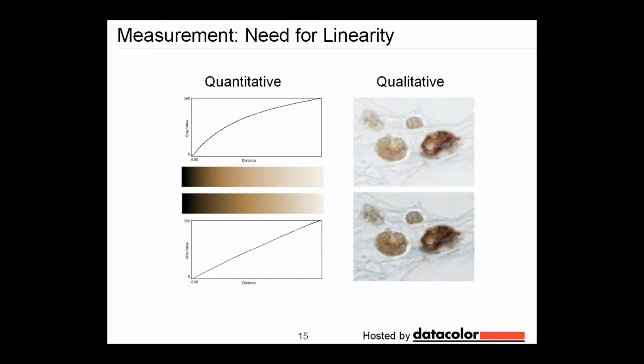A little bit about linearity. When you take an image, the idea is that you have equal increments of tone as you work your way from dark to light, represented by this graph underneath this particular gradient. If you change that and make your image nonlinear, you no longer have equal increments from dark to light, and you've actually created a scenario in which, were you to measure from this sort of an image, you would get erroneous measurements unless you calibrate against a standard.